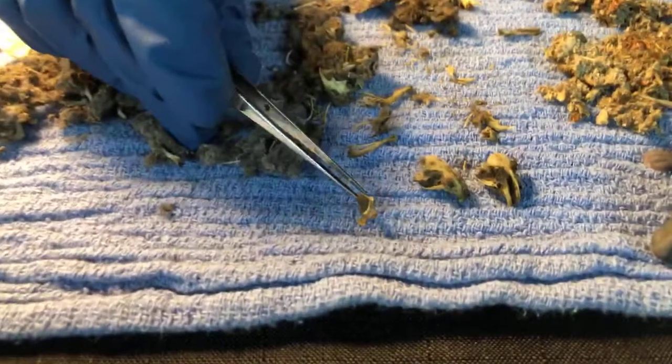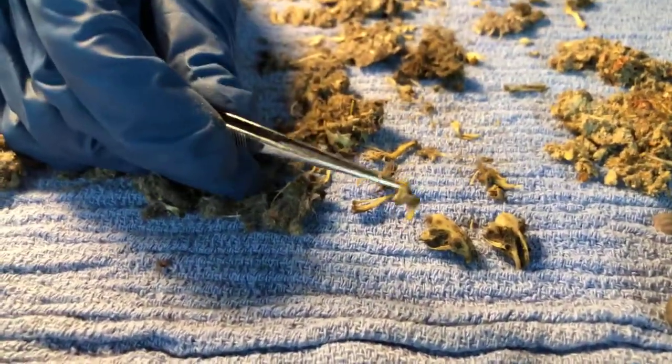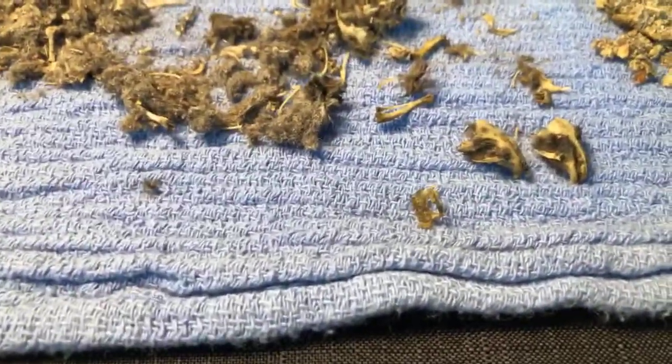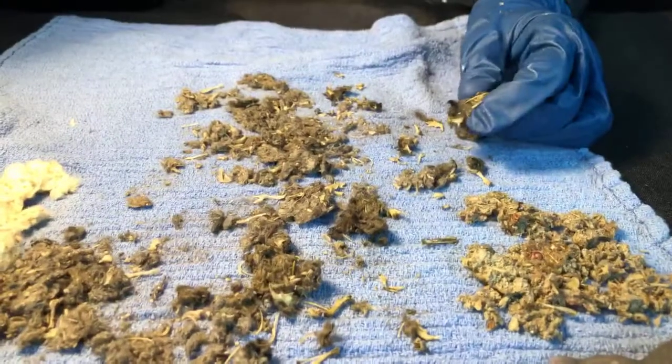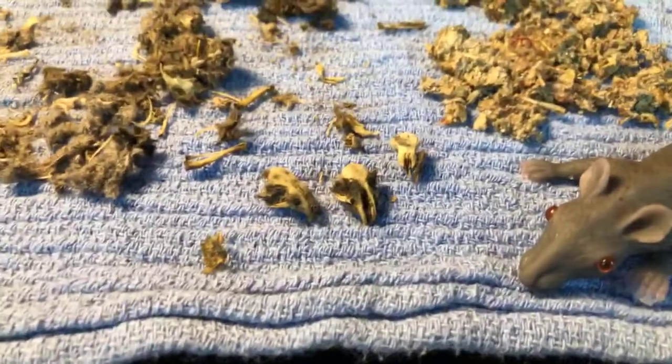What have you got there? That looks like some sort of maybe ribcage. Is that like a pelvis or something? Right. So interesting. Let's scoot the light over just a tiny bit more. There we go. And you can actually order owl pellets online. You can get kits, and they've been sanitized. Oh, and another, 3 skulls. Got another skull. Isn't that so fascinating?